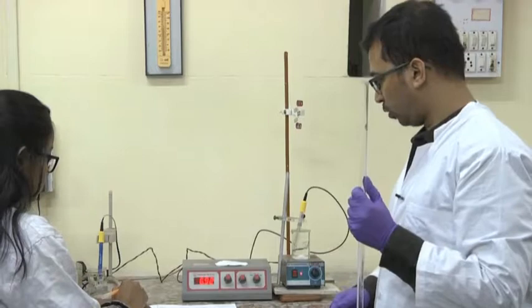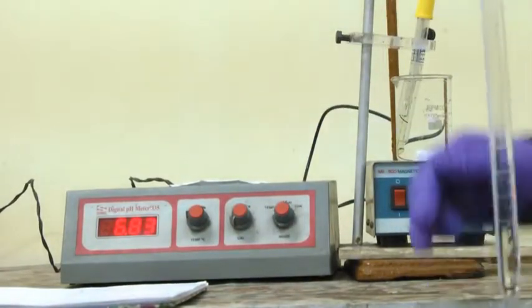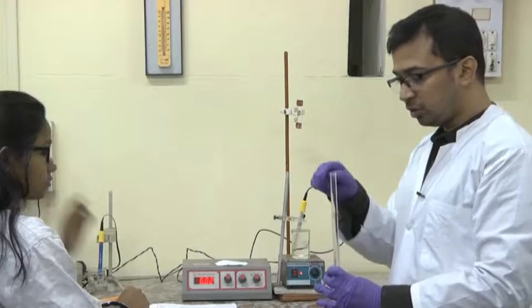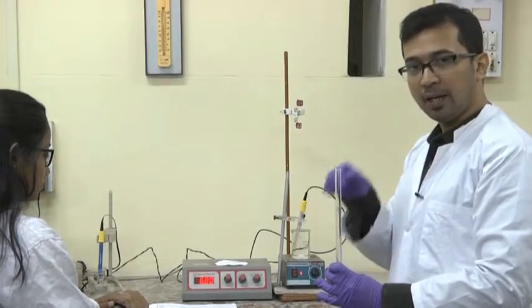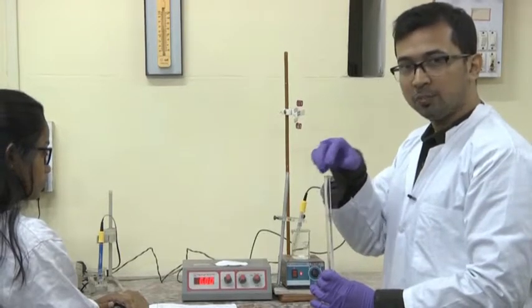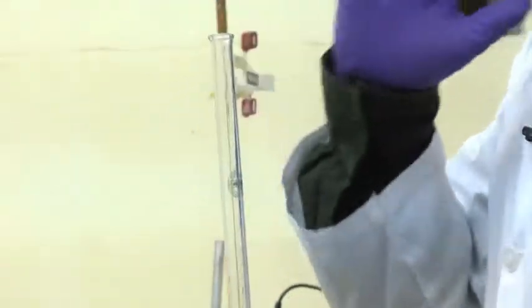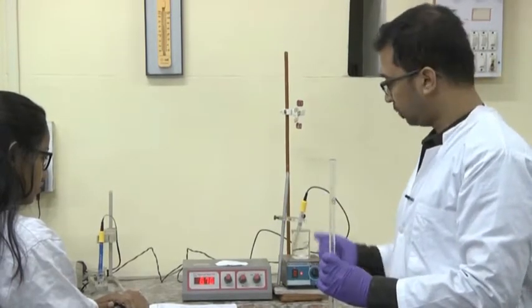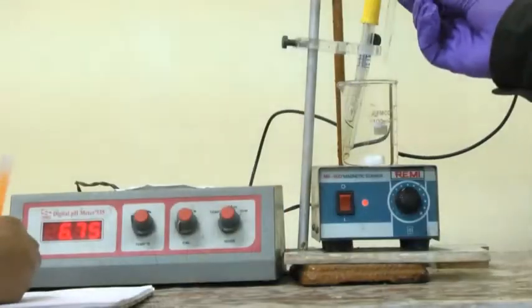We see a rapid jump from 5.1 to around 6.9, but it decreases after homogenization. What happens is that NaOH locally accumulates near the pH electrode bulb, causing an initially high reading. Once the NaOH molecules are homogenized within the solution, the concentration near the bulb decreases and pH drops again. It is better not to note down pH values immediately after adding drops — give it some time for stabilization. Once it reaches a fixed pH, then note it down. The stabilized pH is 6.76. Adding 2 more drops gives 7.22.